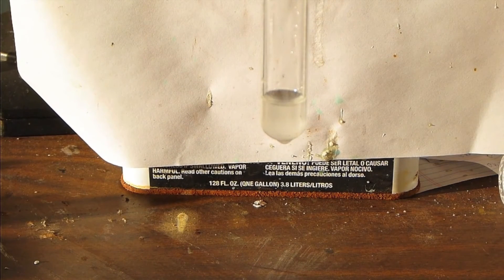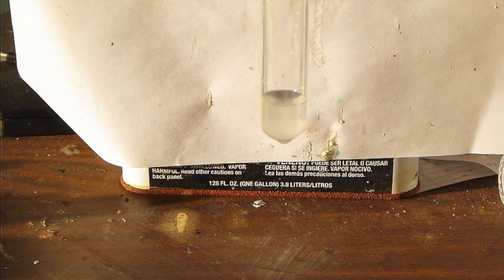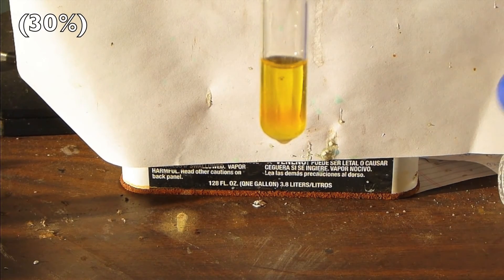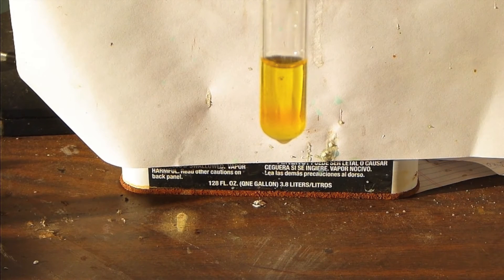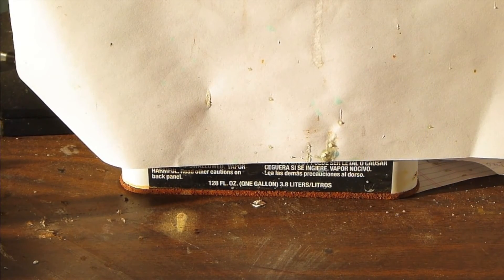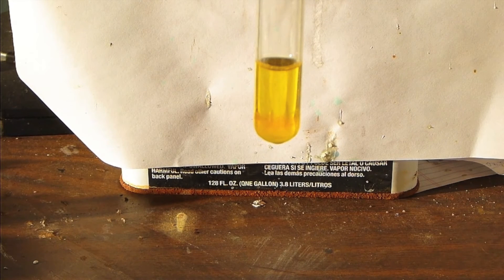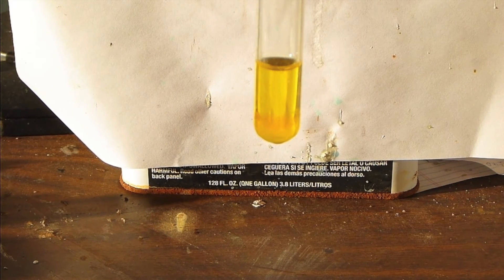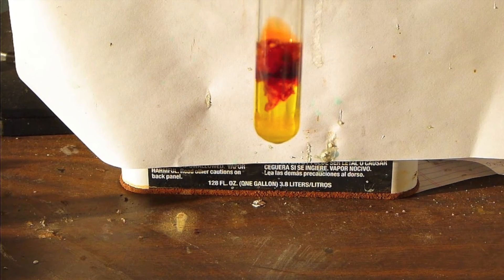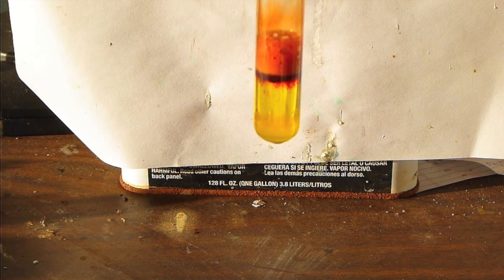Now I'm going to experiment with molybdenum peroxide complexes at different pHs. Here is some ammonium molybdate — it's a neutral solution — and now I'm adding some hydrogen peroxide. Since molybdenum is in the highest oxidation state it can easily get to, and hydrogen peroxide is fairly oxidizing in neutral solution, there's no oxidation or reduction going on at this point. The molybdenum is simply forming a complex with the peroxide ligands, and as you can see, it's a very nice yellow color. Now I add a drop of saturated sodium hydroxide solution, and there's a bright red layer that forms at the top of the liquid, followed by a column of bubbles. The layer moves its way down the test tube.